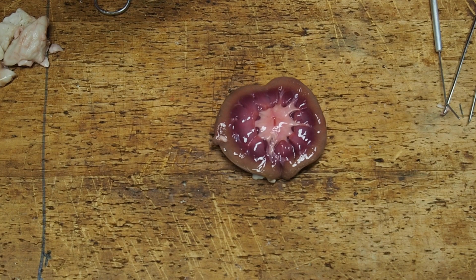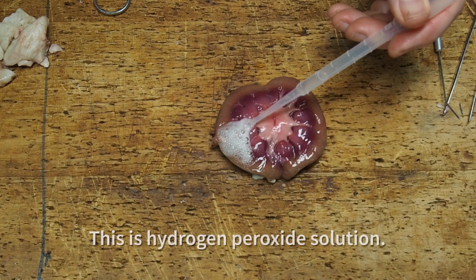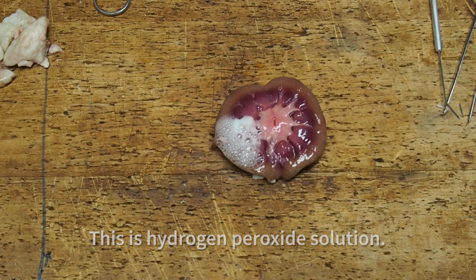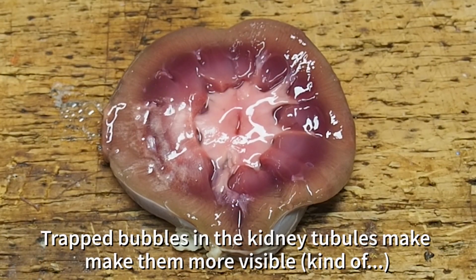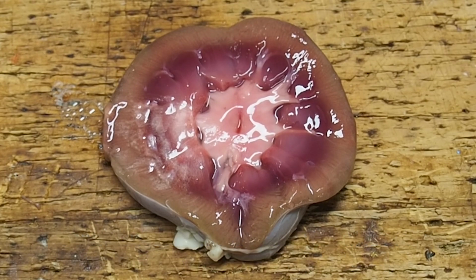Now I'm just going to add a little bit of hydrogen peroxide solution to this. Hydrogen peroxide is broken down by an enzyme in the kidney tissue, and it produces lots of tiny oxygen bubbles. You can see the oxygen being produced. Those bubbles get stuck inside the tiny tubes of the kidney, and it makes it easier to visualize them. It's easier to see this live.